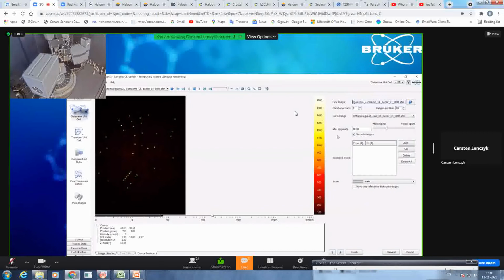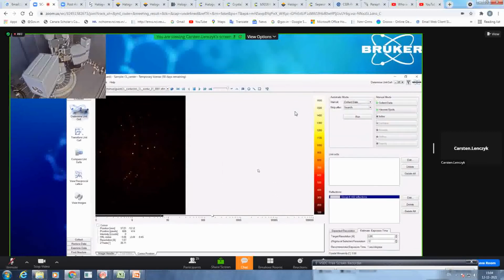It shall use for the unit cell determination the first run, and out of this the following 20 images starting from 1. It will take all the reflexes into account fitting this criteria. So it has to be at least a minimum I over sigma of 10. If you have icing or you want to exclude some shells, you can also add them here. And all the reflexes it will harvest, it will store them into this gray group. So we leave it as default, and you see here now that it has harvested 442 reflections.